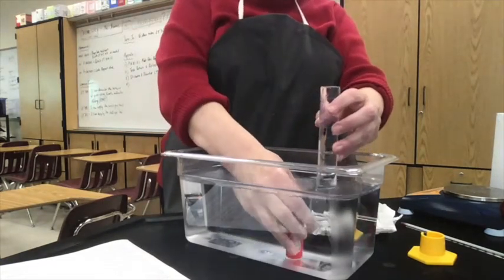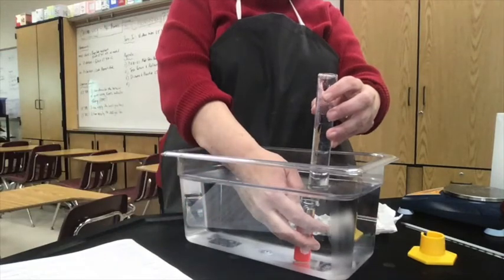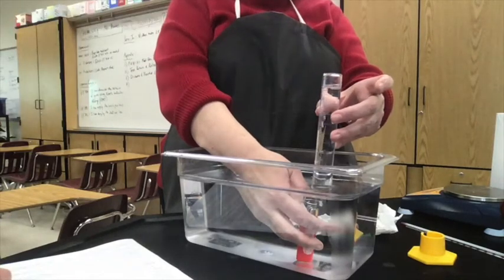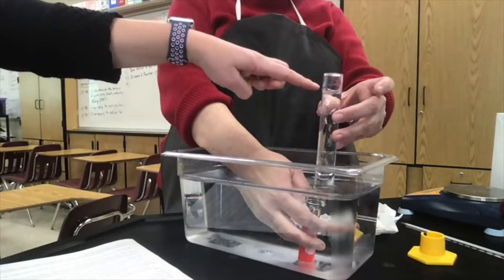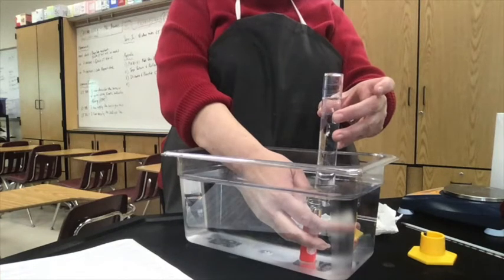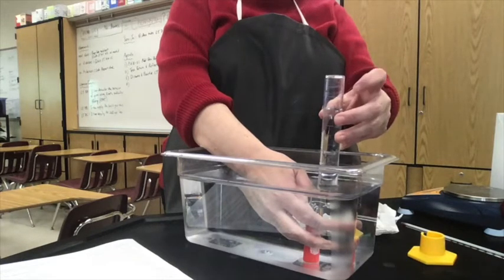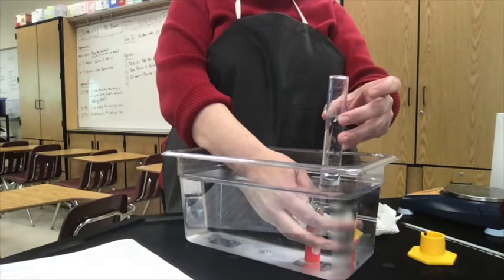This process is known as water displacement, or collection of a gas over water. She's making sure that all the bubbles are going into the graduated cylinder and not on the outside, because if we lose some bubbles, that means some of the mass of butane won't be accounted for in the volume. We're collecting about 45 milliliters. An important thing when collecting gas this way is that you're not just collecting butane — water vapor at the surface has the ability to exist up here with the butane gas.